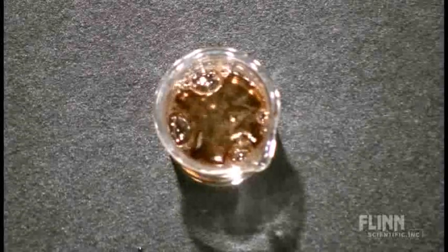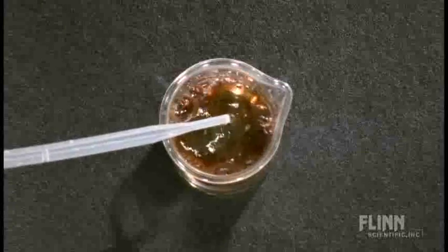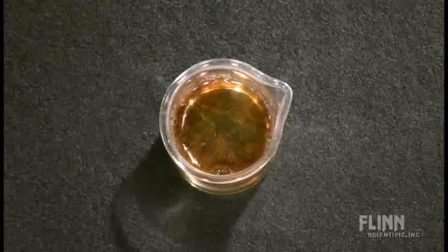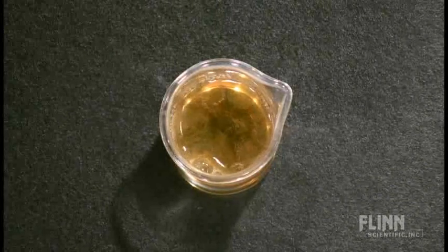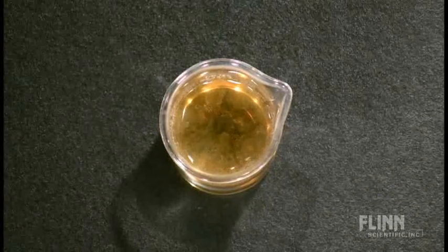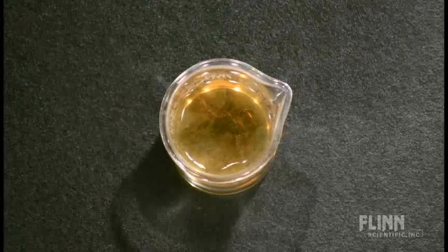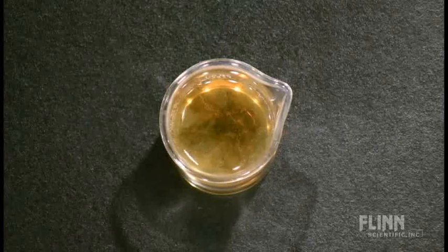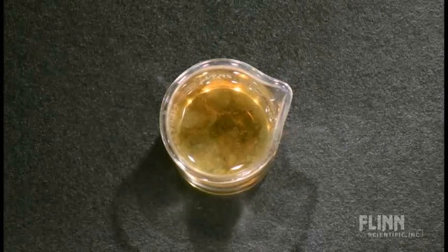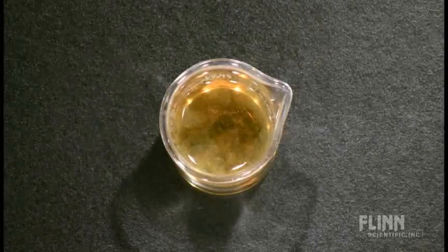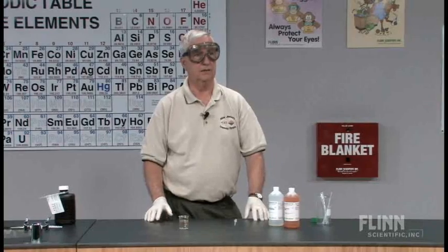If I take sodium phosphate solution and I add a small quantity of it, you will notice that the reaction slows down very rapidly as the phosphate ions react with the iron ions causing a precipitate. And you will notice the cloudy yellow-brown precipitate that forms on the top of the solution. This inhibitor stops the action of the catalyst from decomposing the peroxide further.